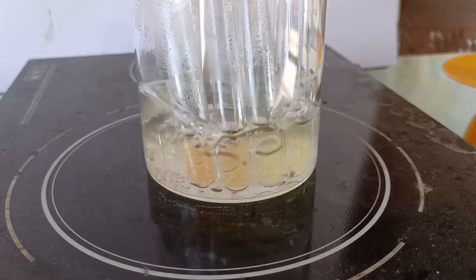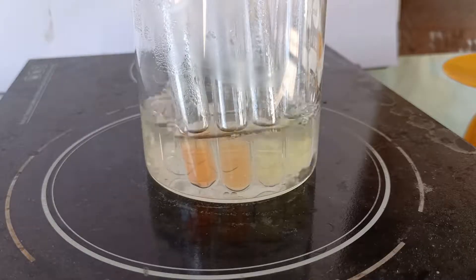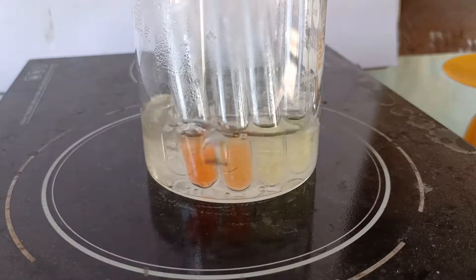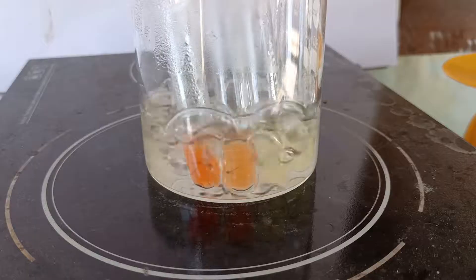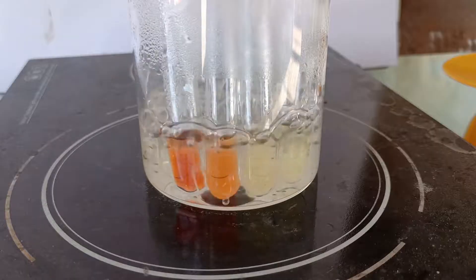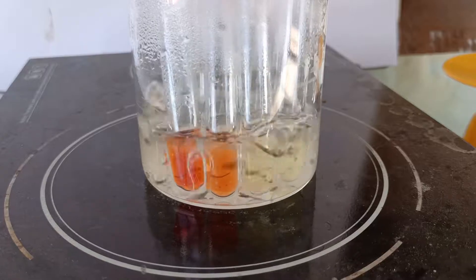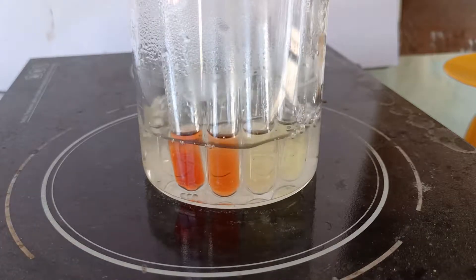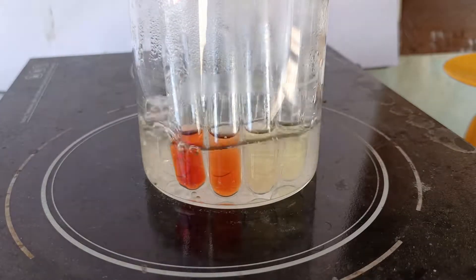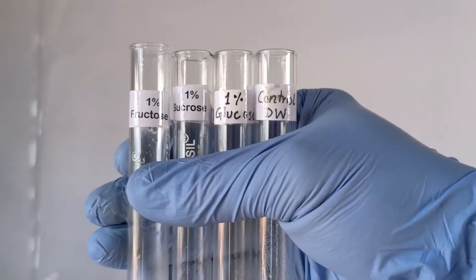The test tube containing the ketose monosaccharide fructose is the first to change to a cherry-red color within a few minutes, followed closely by the 2nd test tube containing sucrose, which took extra time for the acid hydrolysis of sucrose into its component monosaccharides glucose and fructose, of which the ketose sugar fructose participates in the Seliwanoff's reaction to form the cherry-red complex. This is still considered a positive test. The 3rd tube containing the aldose sugar glucose took an even longer time of more than 10 minutes to show a very faint pink color, which distinguishes it from the ketose sugars that show deep red color reactions.